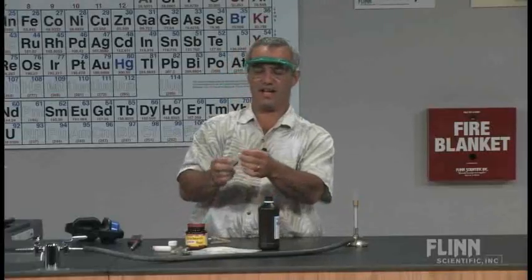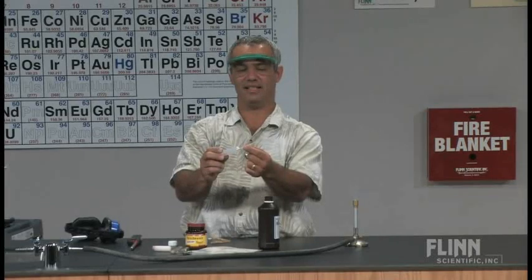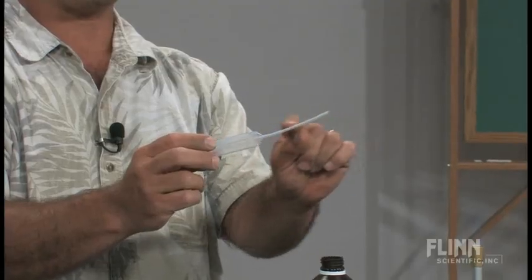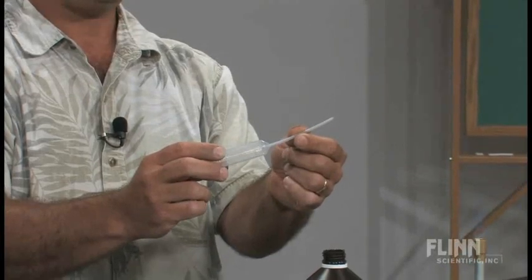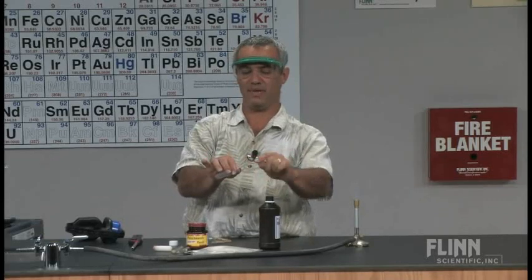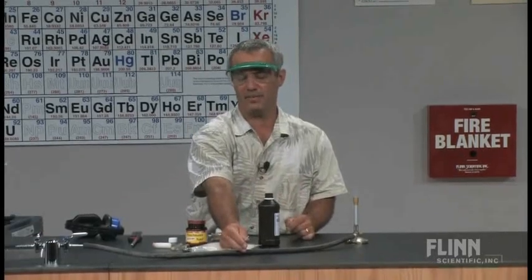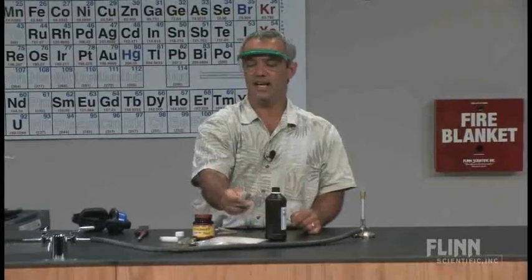The other thing I've got is a plastic pipette with a large bulb and a rather thin stem — traditionally used for titration, where you want large capacity and a thin stem. I actually pulled the tip out a bit and then cut it off, so you can see it's been tapered. That's going to give me a nice quick delivery of my oxygen gas.